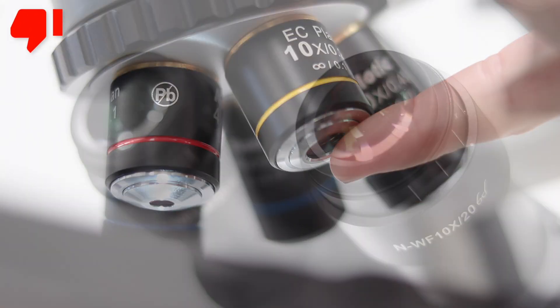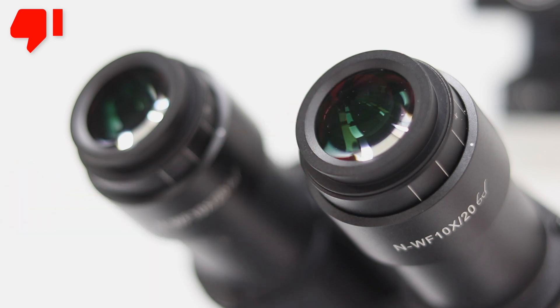Remember, it is especially important to not touch any of the lenses with bare fingers.